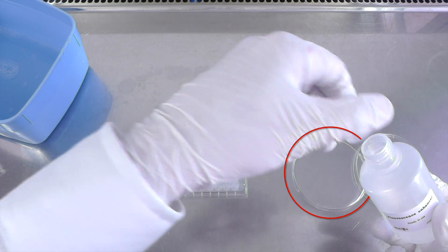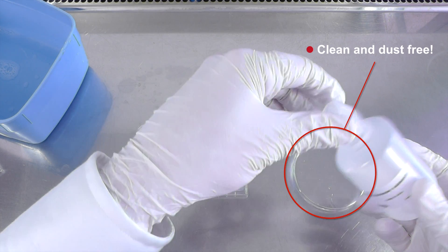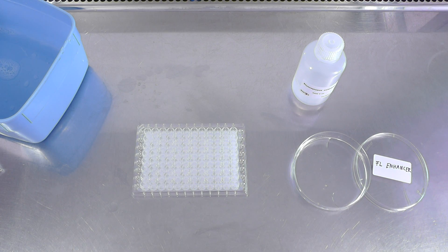Remember to use a clean container. It does not need to be sterile, but dust particles often auto-fluoresce and can lead to unnecessary background.